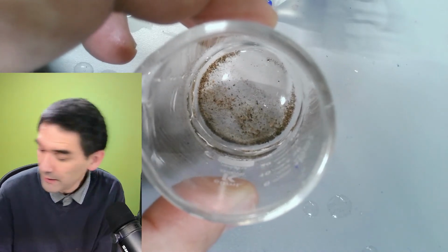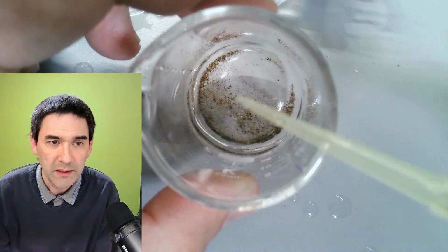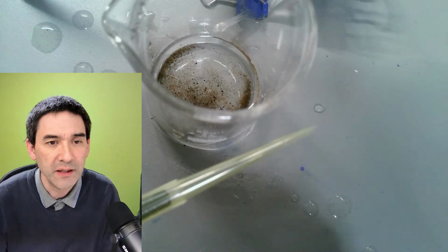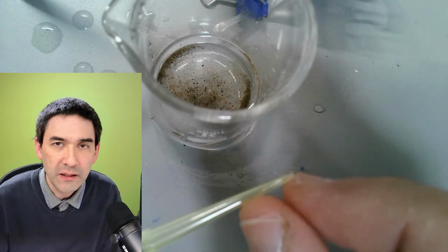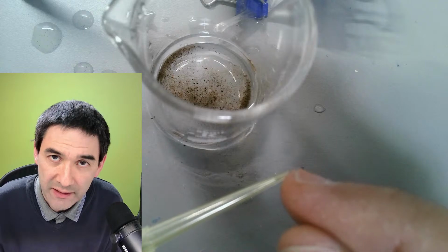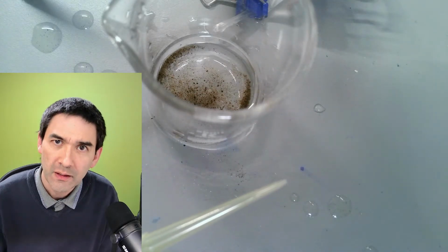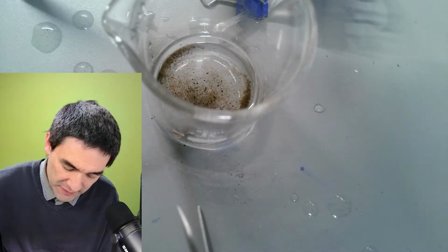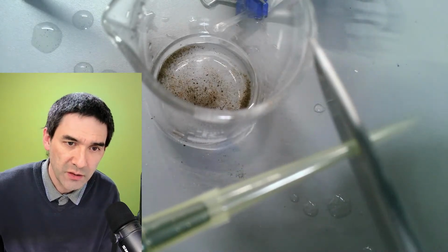Then you need a pipette. Okay, so what I've done now is the following: I've got a pipette here, and there is something I found out that I would like to share with you. The opening of the tip is a little bit too narrow. This can be seen as an advantage because then all of those solid particles are not sucked in. But sometimes water bears and so on like to cling to solid objects. So for this reason, I usually cut it off.